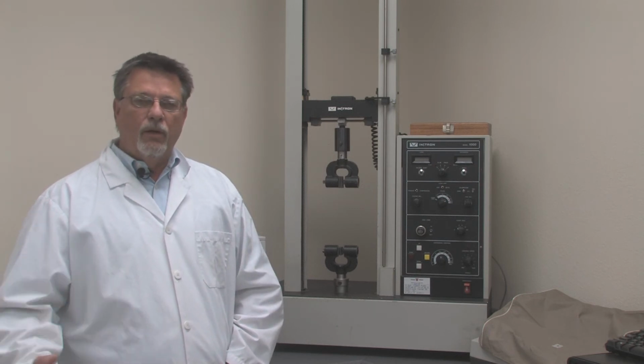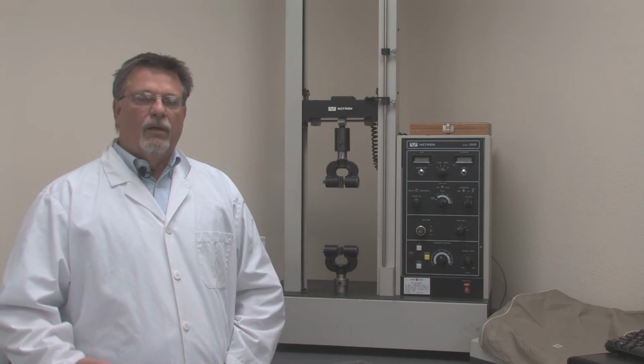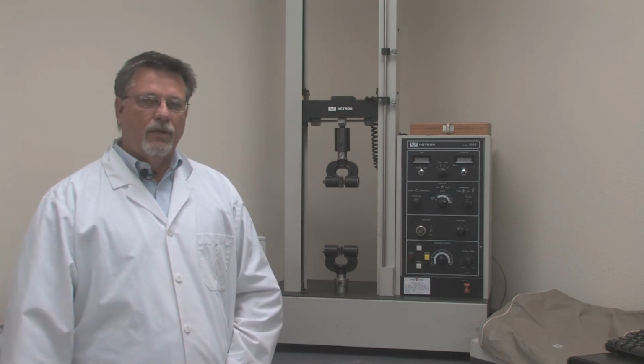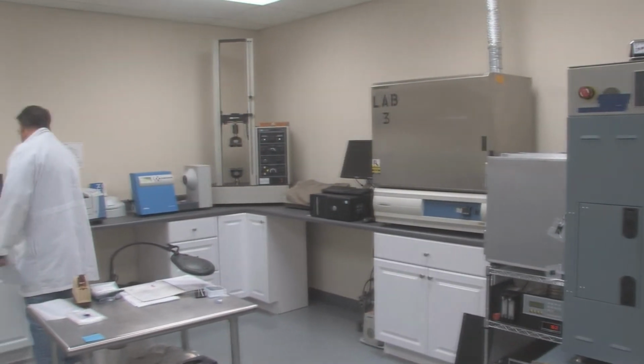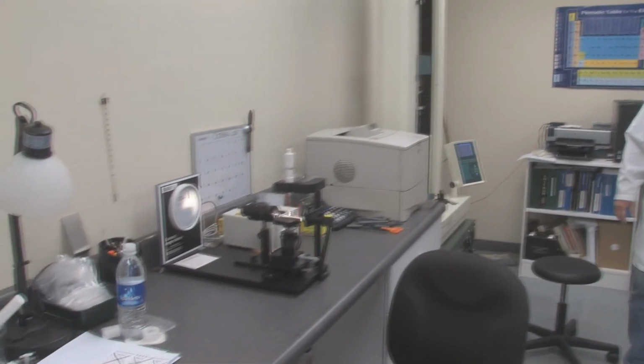The one thing we do here in the lab is a lot of development work with chemistries and adhesives and substrate qualifications and so forth. So this is a very handy tool when it comes to identifying whether a material is or isn't meeting standards. Some of the other devices we have in the lab for both analytical work and development work are things like ovens, where we will take materials to certain temperatures and do evaluations on them. We have some small presses. We have a lot of scales to measure things like specific gravity and gram weights. Cupboards full of chemicals. Again, part of the work that we do here in the lab is new product development, and so there's a lot that we do in terms of labware and combining materials.